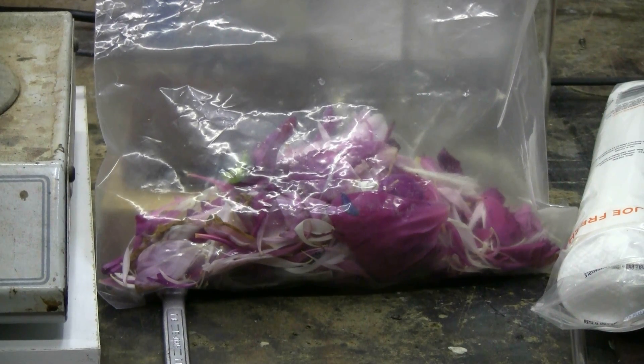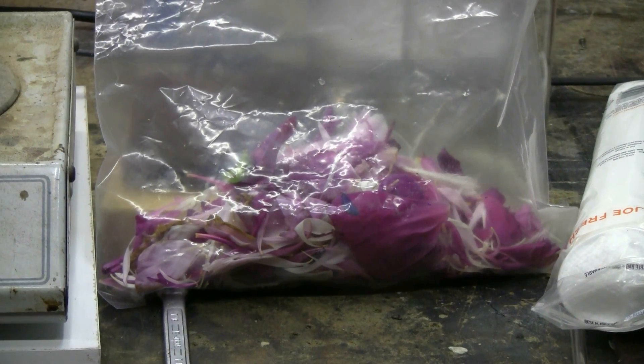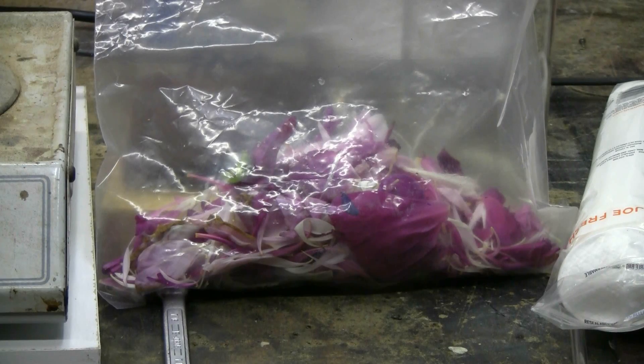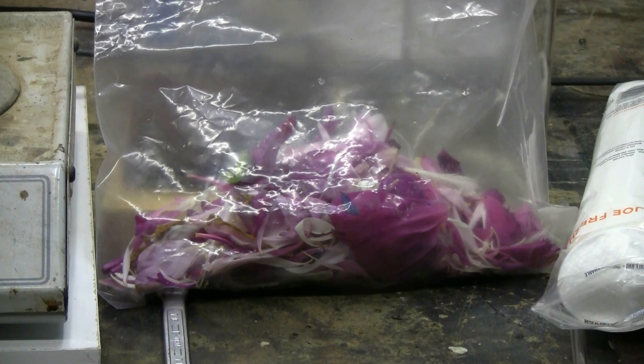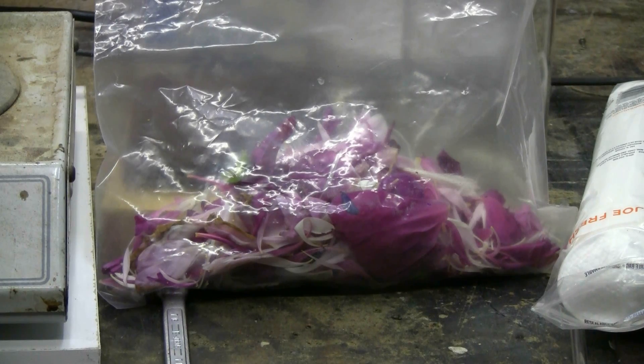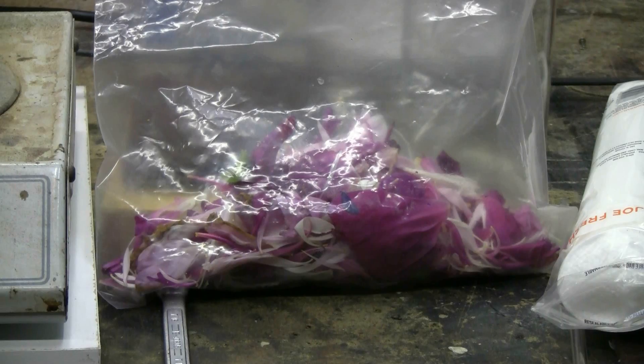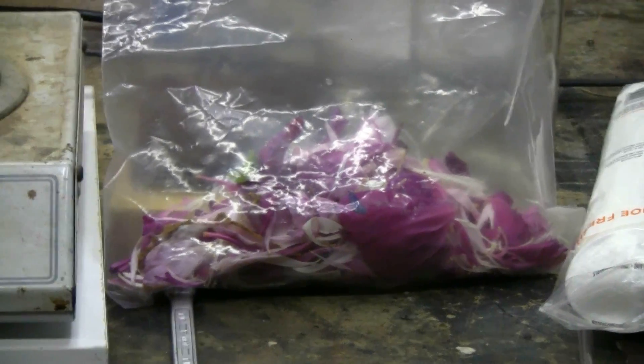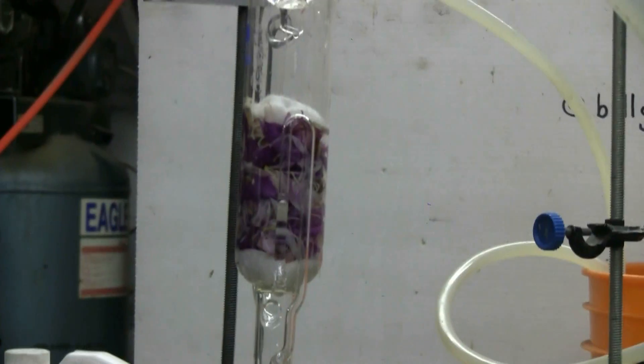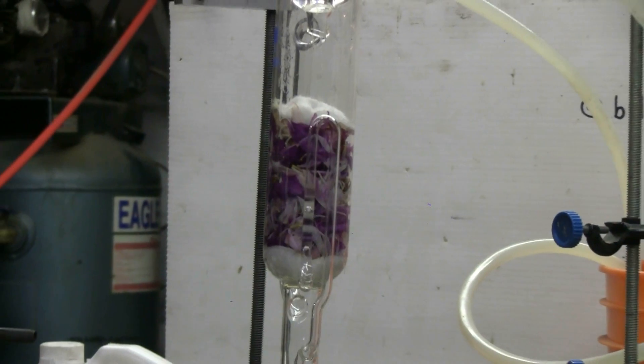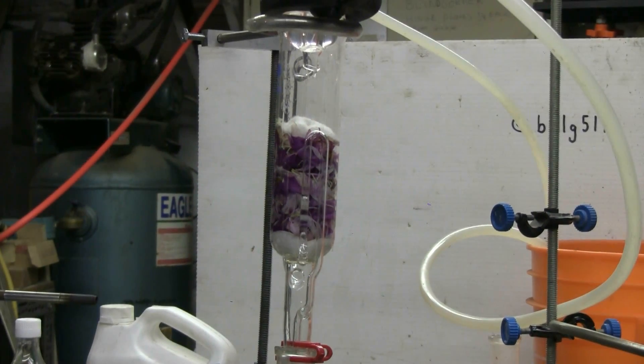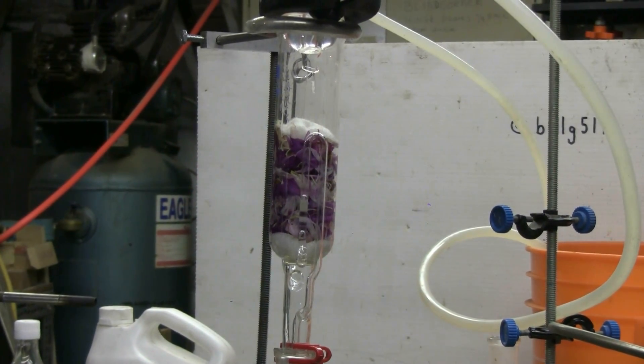Today I've decided to try a Soxhlet extraction from fragrant peony flower petals that I collected from my garden. As you can see, I brought a bulk of the petals in a plastic bag and some of them have been loaded into the chamber of my Soxhlet extractor.